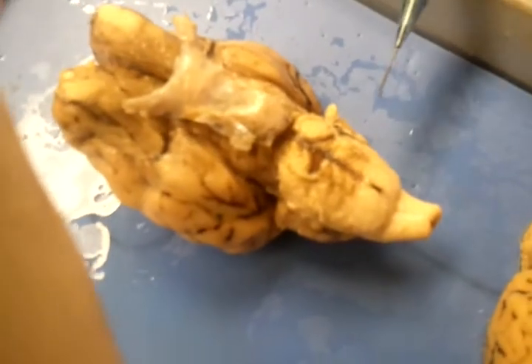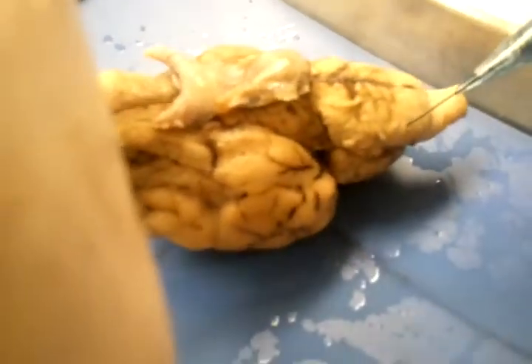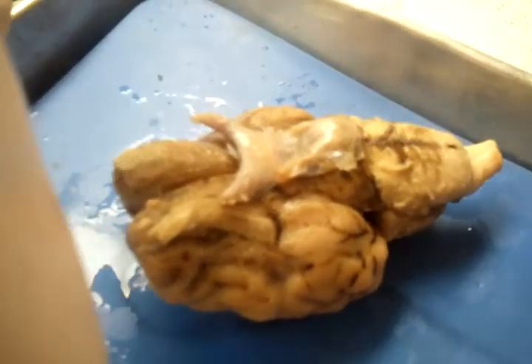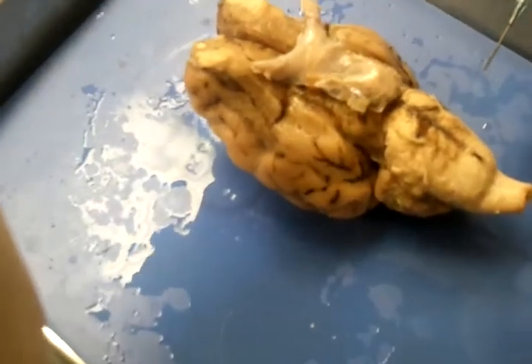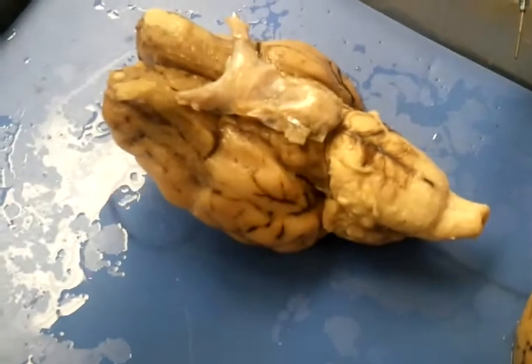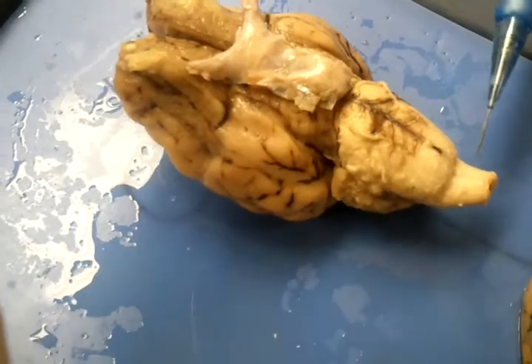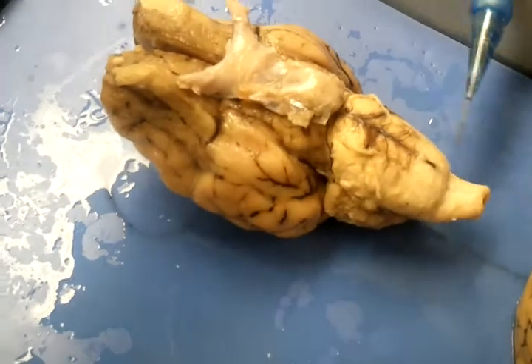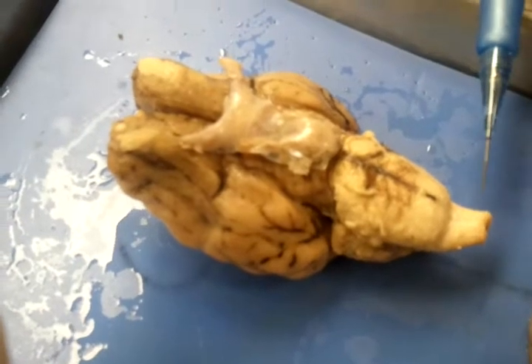And then we come a little bit farther down on this side, you can see it, we have the facial nerve, which is nerve number 7. And then we are also missing the vestibulocochlear nerve, which is nerve number 8. And this nerve would be around this area right here. The hypoglossal nerve, which actually looks like a bundle of nerves, would be located around this area, and it's nerve number 12, although it is not visible either.